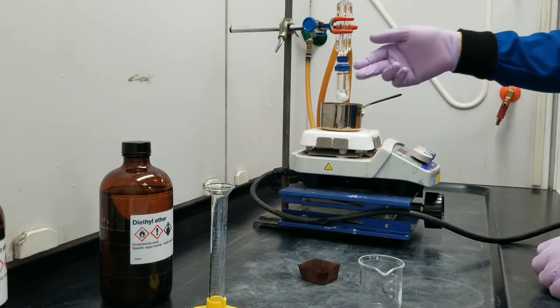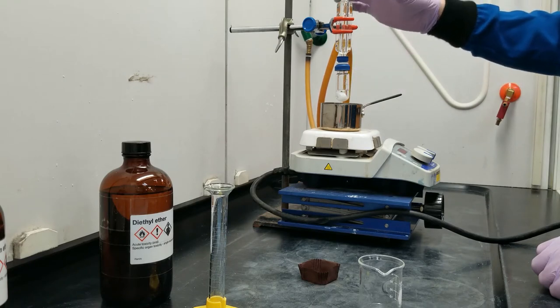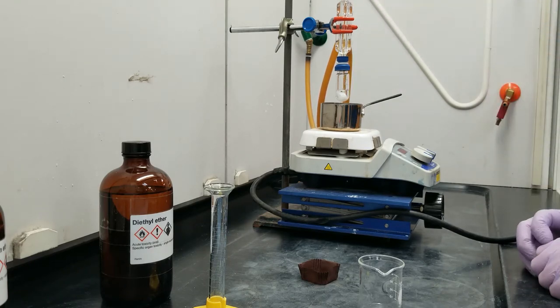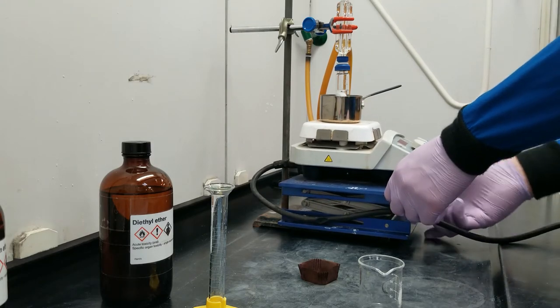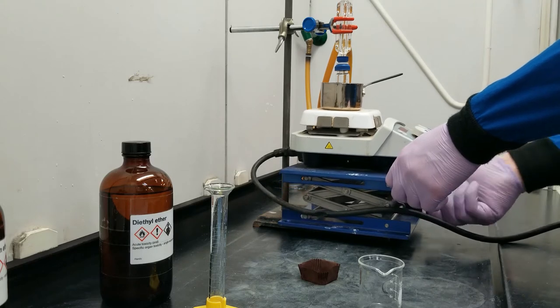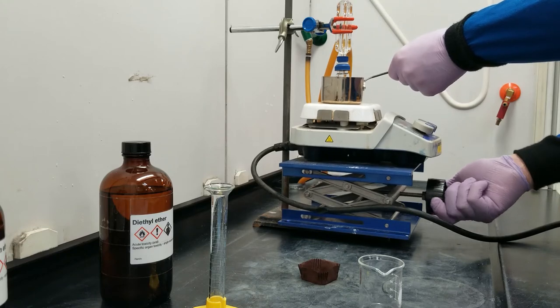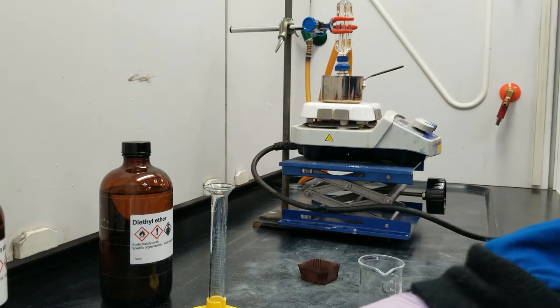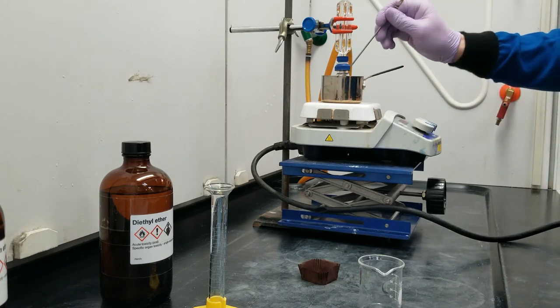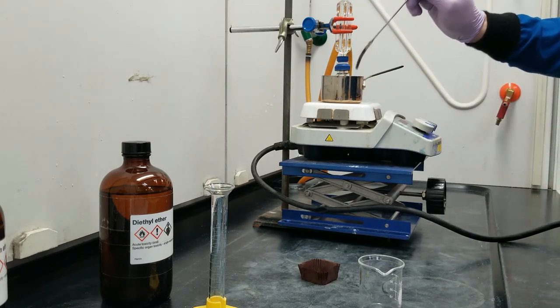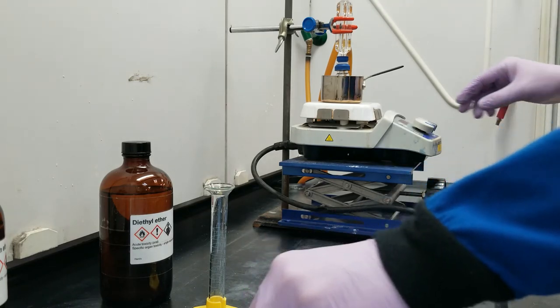Now this is ready to heat. And the vapors inside here will head up here. They'll be cooled down and be put back in the system, so we won't lose our solvent. With all of that explained, we're going to contact the bottom of the saucepan. And then, I'm going to take a little spatula, and I'm just going to push a little bit of sand around the round part, up the round bottom. And I'm going to get my stirring on.